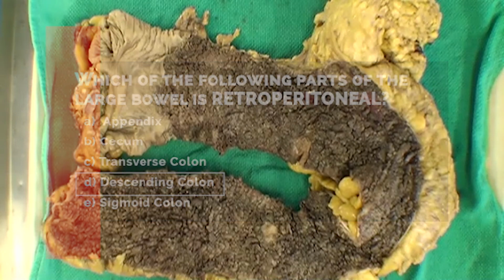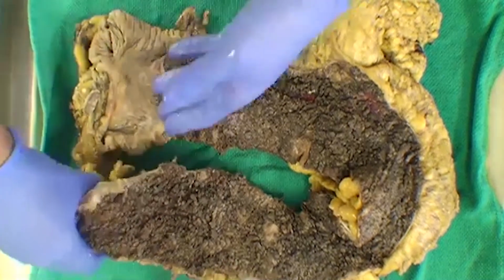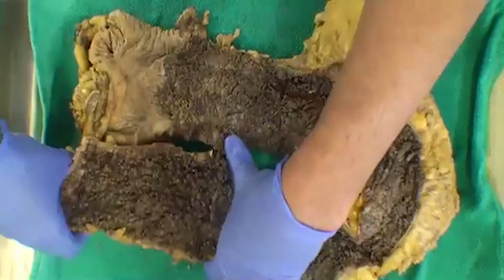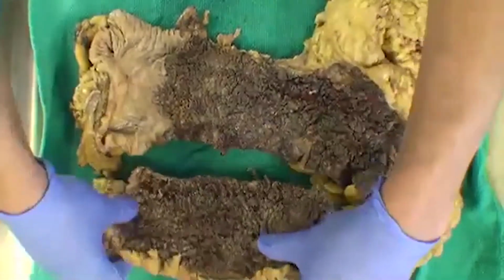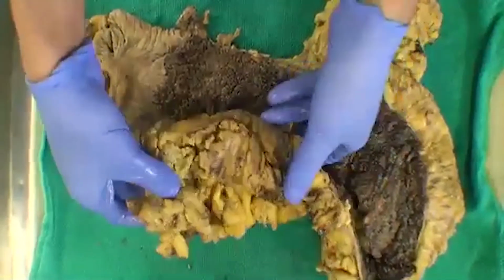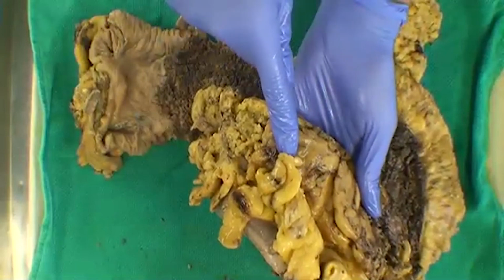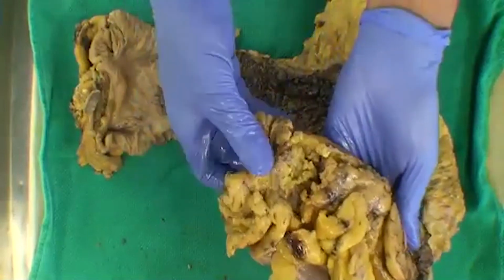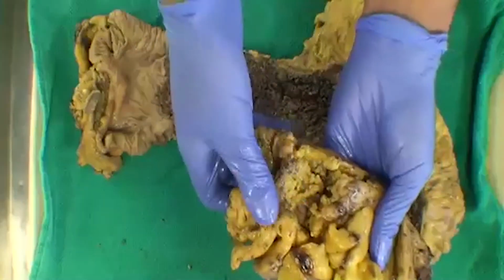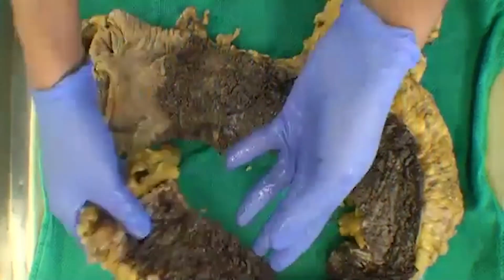If we have a segment of bowel that's retroperitoneal, like the descending, we're going to have a true radial margin in the retroperitoneal aspect where that part of bowel has been dissected off. I think we have a bit of it represented here. If you look at the specimen, it's quite smooth over here, which is probably more of the transverse, which is intraperitoneal, but then we have a more roughened area here, which is probably a true margin where the descending is maybe starting in this particular specimen.